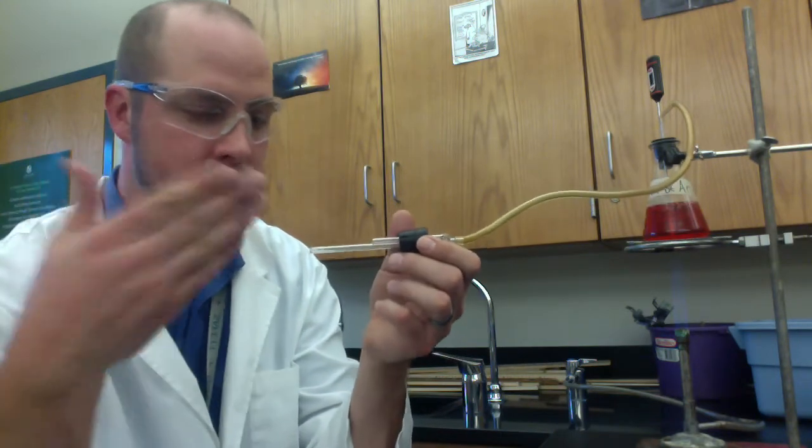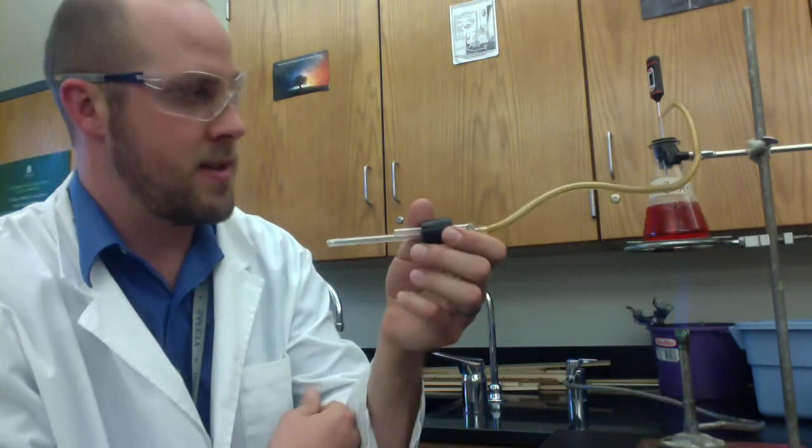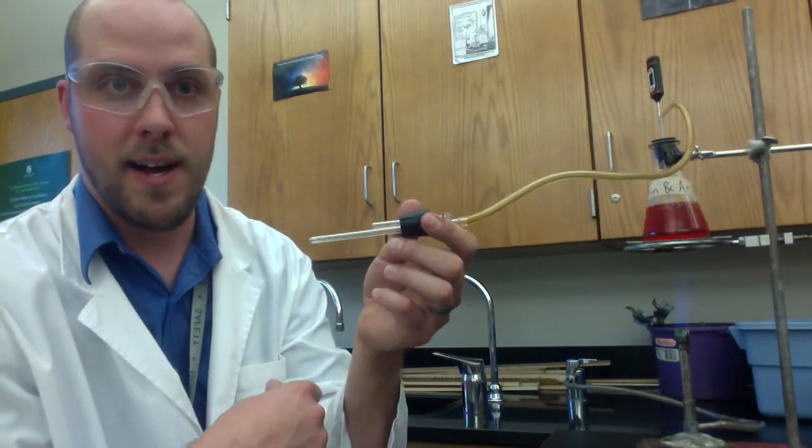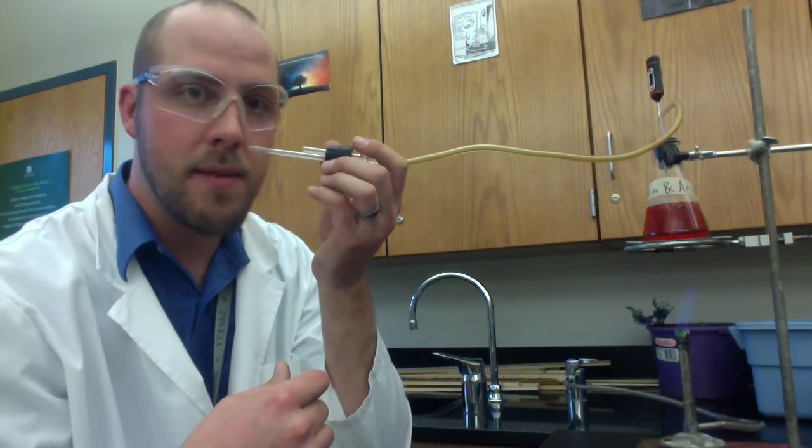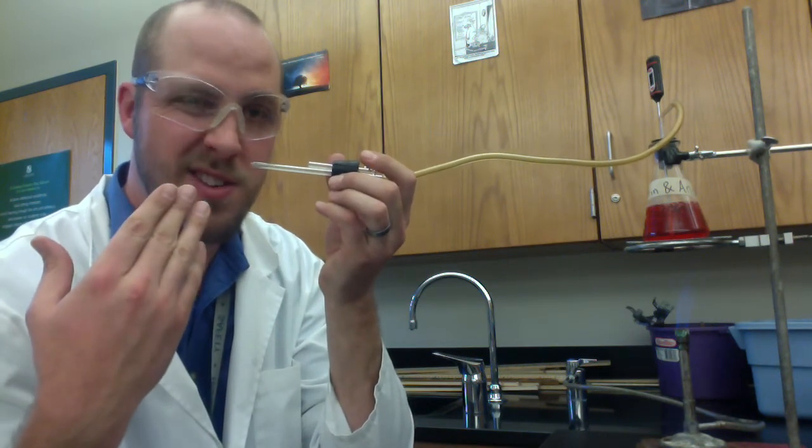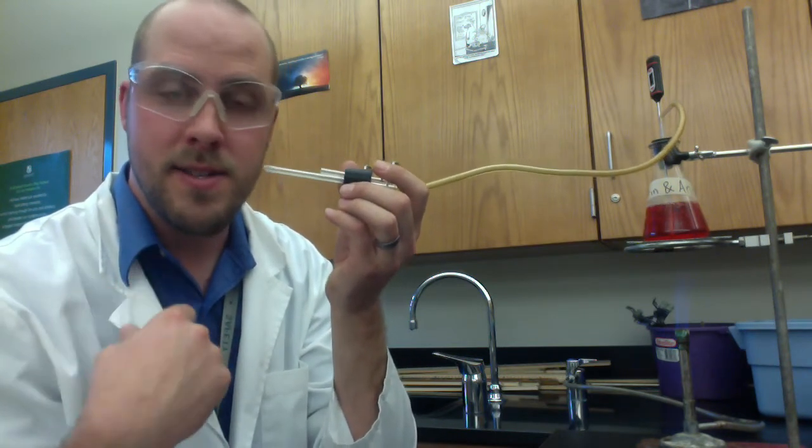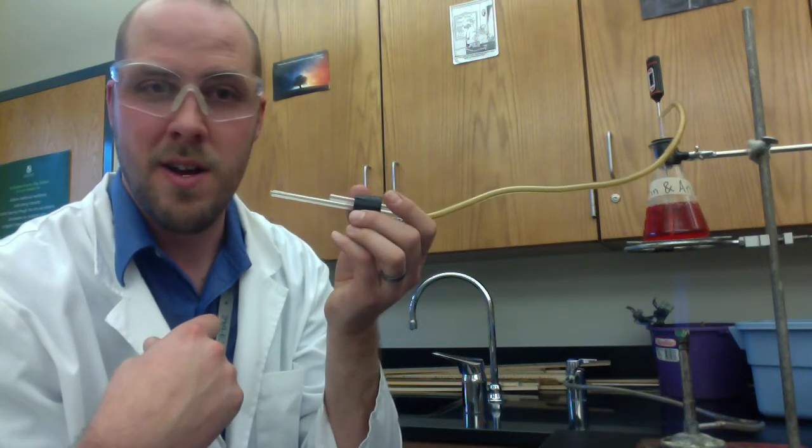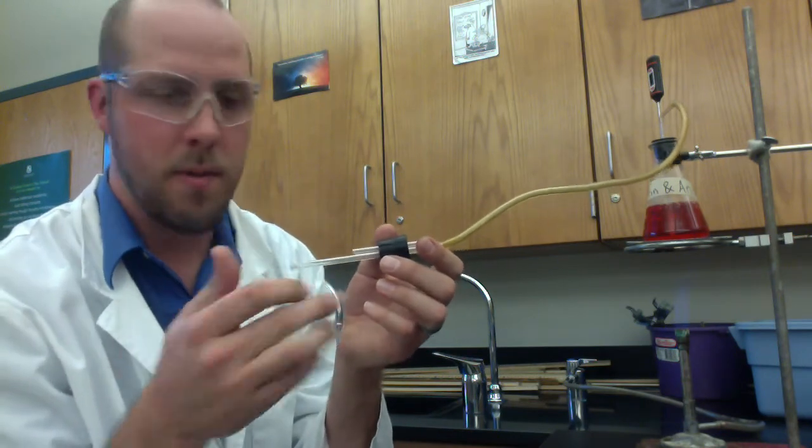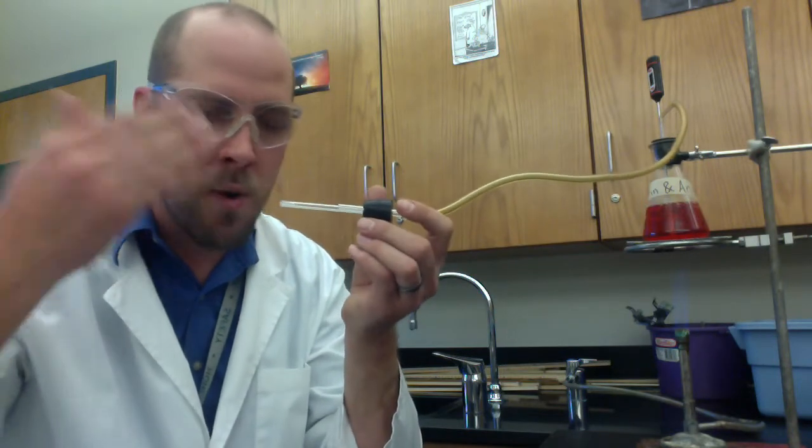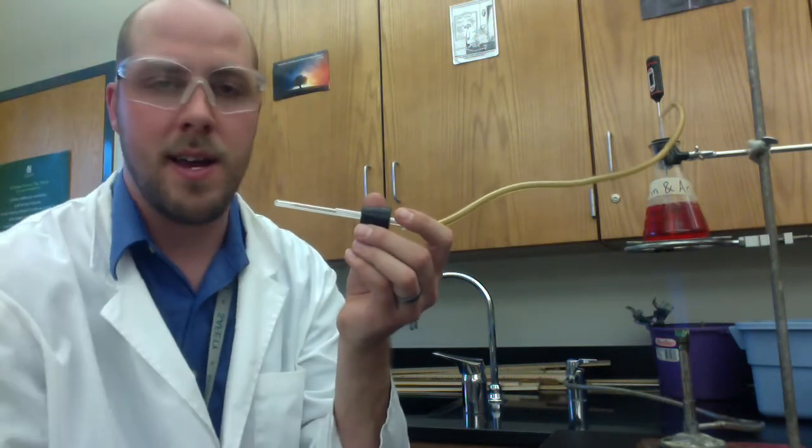We want to start smelling by wafting to see when that fruity ester boils off or comes off the solution. I mentioned in all the classes this week that one student hurt themselves because they put this right up to their nose and they were waiting to try to smell the fruity ester. They actually passed the point at which the ester came off and all of a sudden steam started coming out and she basically inhaled some of the steam into her nose. As you can imagine that hurt kind of bad and it made her not able to smell very well and her nose was sore for a few days. So not permanent damage but not a pleasant experience.